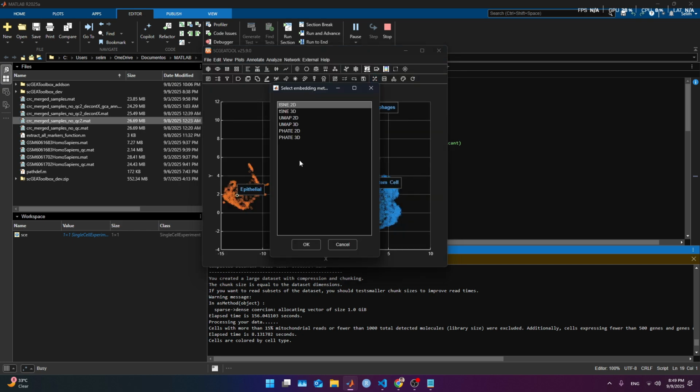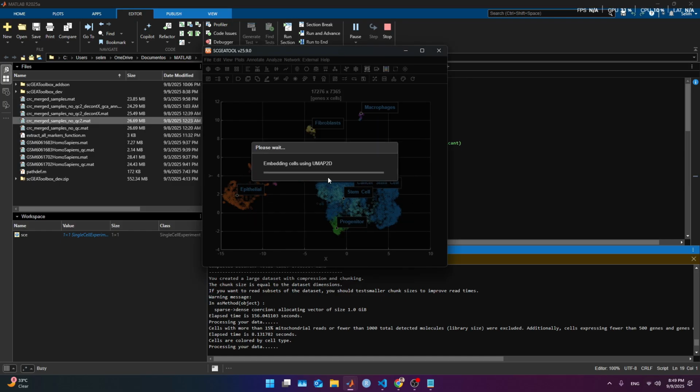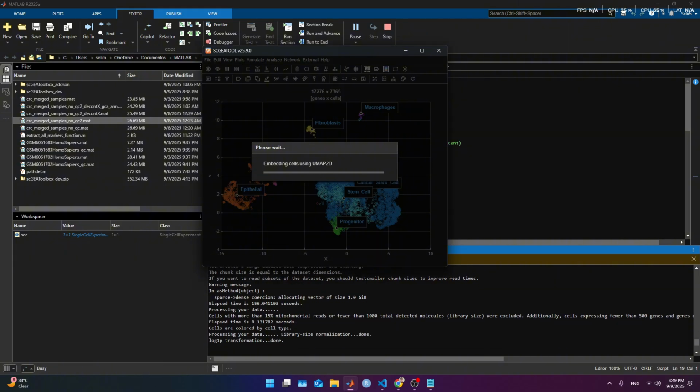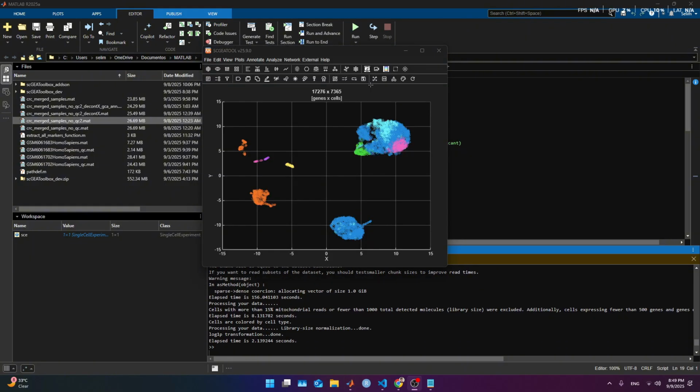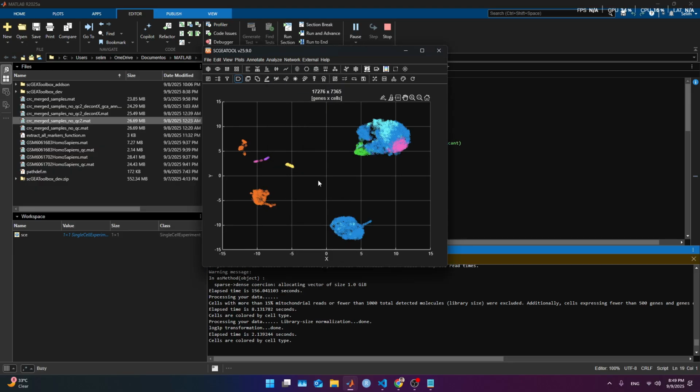Using existing, no. We are going to regenerate the UMAP 2D. Utilizing, in this case, I want to use all the genes. I'm gonna stop it and come back when it finishes. This is what we end up getting. If you see it, now it looks more separated, every single one of them.